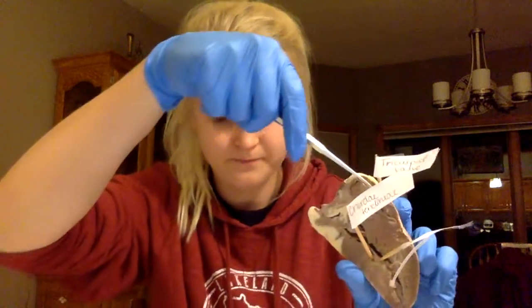And the last of the valves, which is the tricuspid valve, located right here. And it is an atrioventricular valve between the right atrium and right ventricle. Blood will enter in the right atrium, and it has to go through this valve in order to enter the right ventricle.